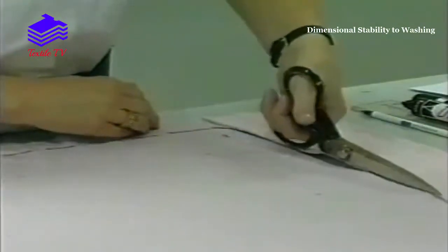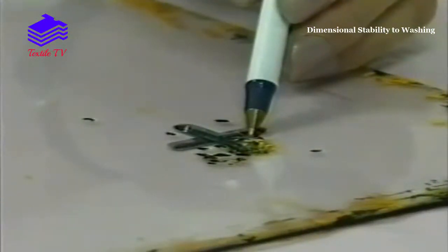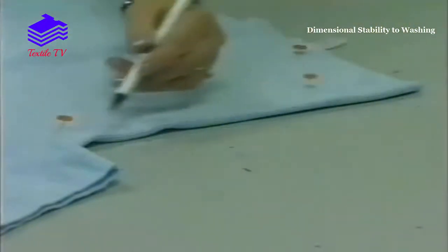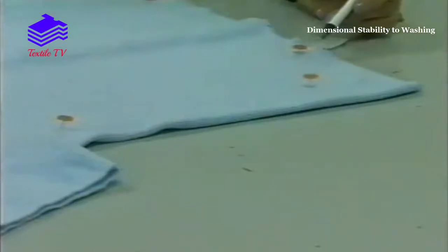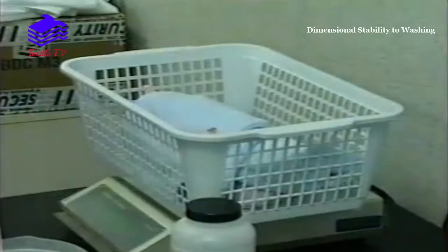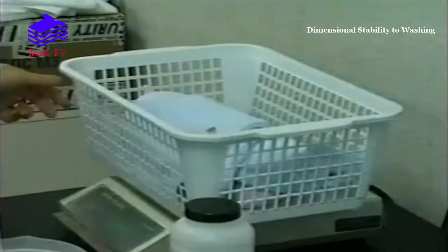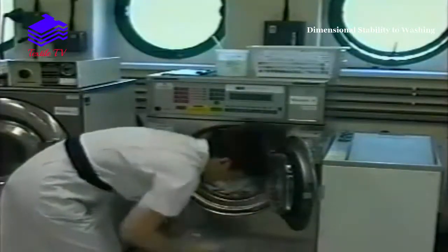A specimen is cut from the sample provided using a template, and reference points provided on the template are marked onto the specimen. Selected reference points are made on the garment so that length and width measurements can be made, usually a minimum of 2 length measurements and 2 width measurements. All specimens for a particular wash programme are weighed and, with the addition of standard make weights, the specified wash load is prepared — usually 2kg — and placed into the Wascator machine.